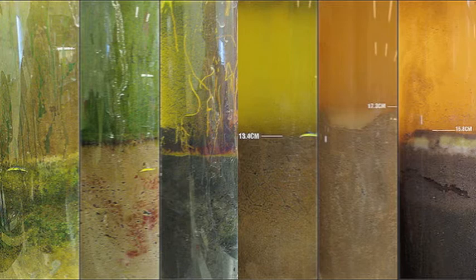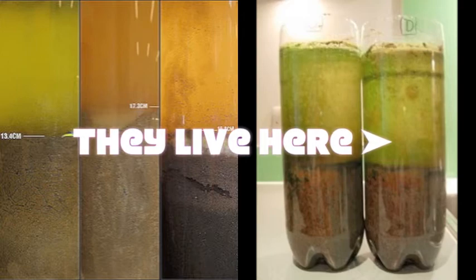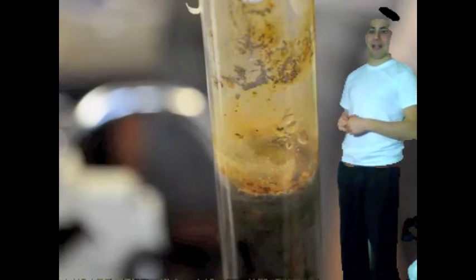Towards the top of the mud phase, algae and other aerobic phototrophs are present. These organisms are responsible for the green and orange color that you may see. Anaerobic phototrophs are microorganisms that do not use oxygen to breathe but use the sun to make food. They are still present to a large extent in the mud phase, meaning there is more room for expansion of the colonies. The top of the column is the aerobic zone, which means oxygen is present. Three different types of organisms reside here. The sulfur-oxidizing bacteria gain energy from H₂S and make organic matter from CO₂ — therefore they are chemoautotrophs. Photosynthetic cyanobacteria grow in the upper zone as well; they oxygenate much of the water. Finally, the sheathed bacteria are aerobic organisms that divide and create new colonies rapidly.